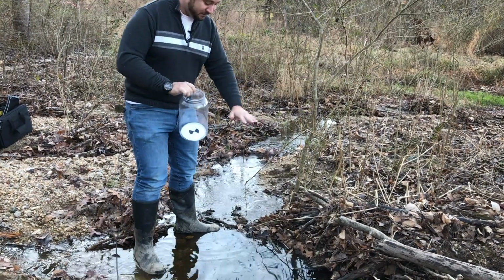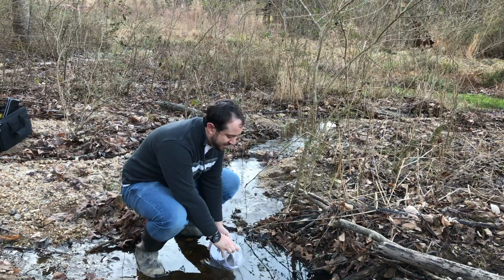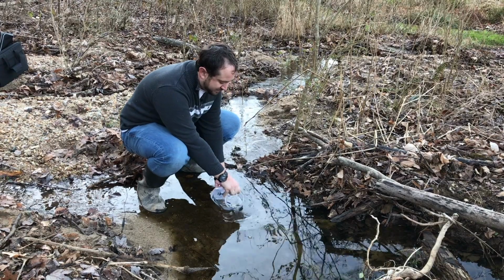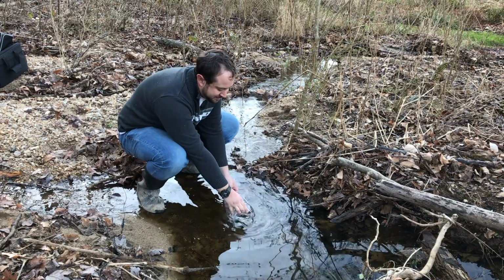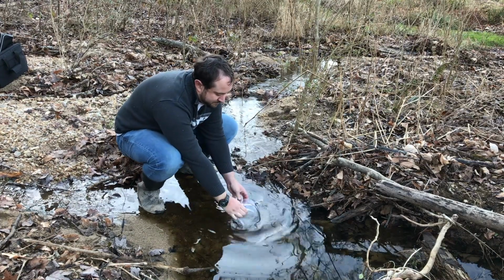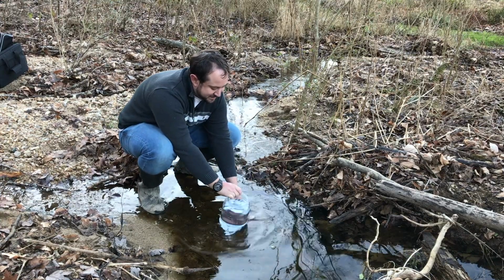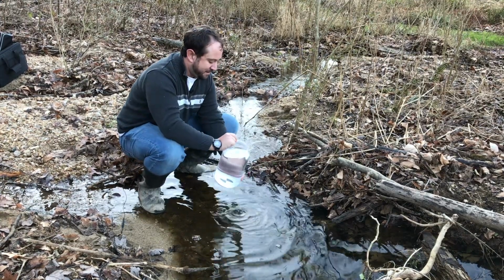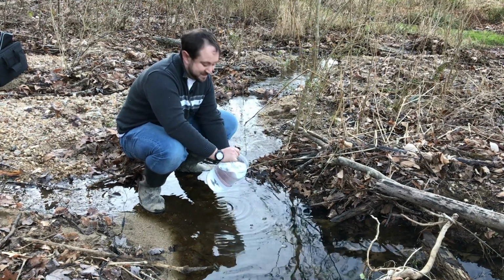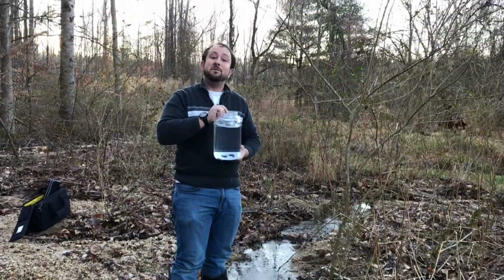I definitely don't want to gather downstream. I want to gather my water upstream. So I'm going to lower my jar and fill in as much water as possible, trying to get to that line there. I just need to go a little bit deeper down. There we go. This is a shallower creek, so it might take a little more sampling. That's roughly what we need. I'm just going to pour a little bit out. If you get some sticks and stuff like that, that's okay. Keep that muck and those sticks, because we'll definitely weigh it out.